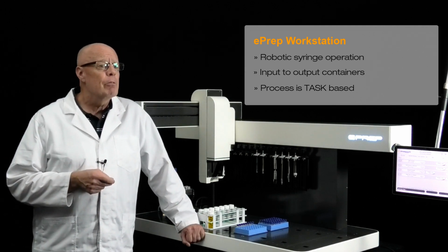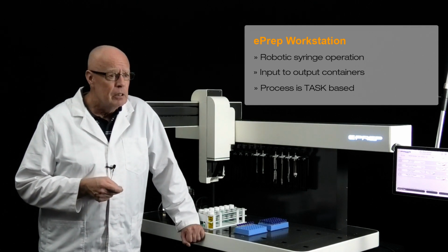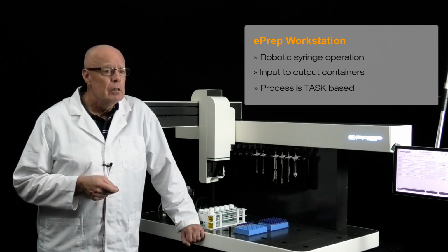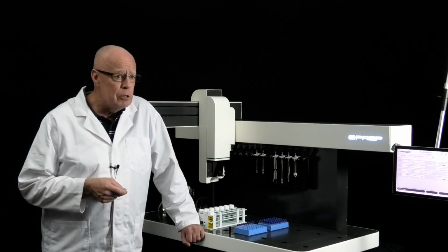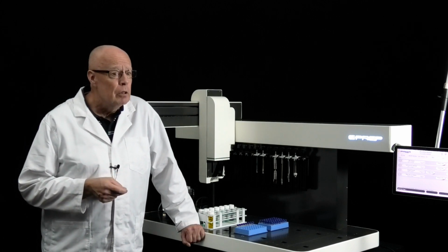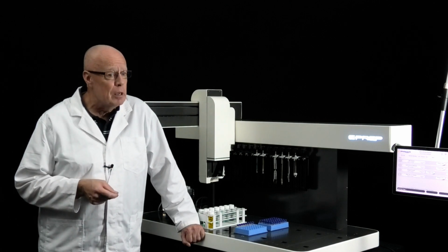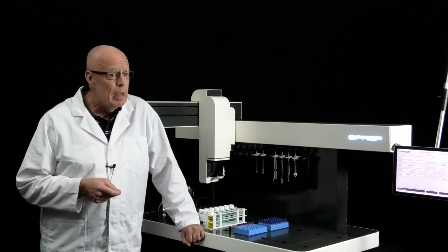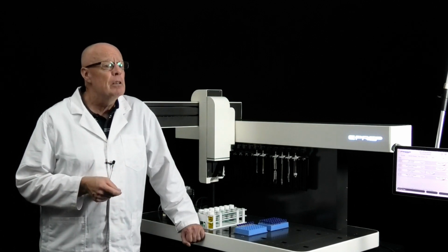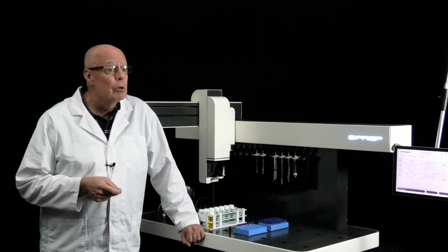To develop a workflow in the software, the user puts together a series of these tasks and nominates the input and the output containers. An example of this might be taking a batch of samples, filtering each one, then taking an aliquot to an autosampler vial, adding something like an internal standard to the same 2 ml vial, and then making this vial up to volume. Then the vial can be taken directly to the instrument's autosampler. I'm going to demonstrate this for you now.